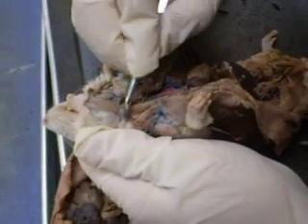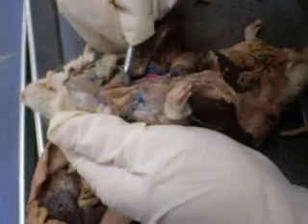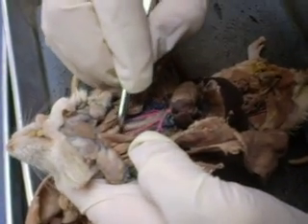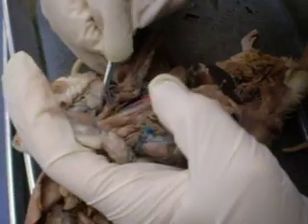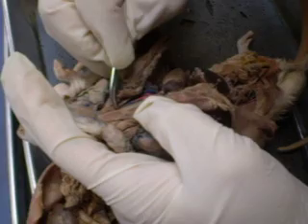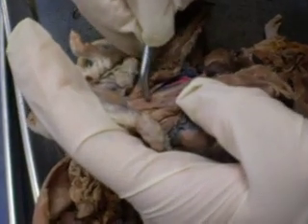Okay. Trachea. The esophagus is kind of like this part here behind it. So the muscle that immediately covers the trachea, sternohyoid. That's how you recognize it. And you go in logical order.